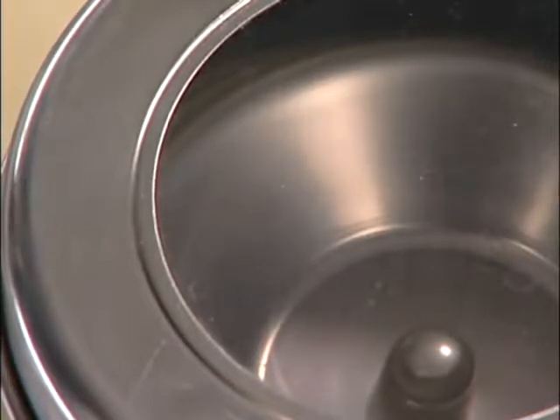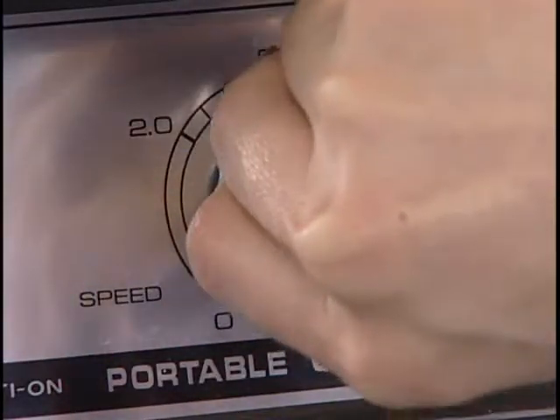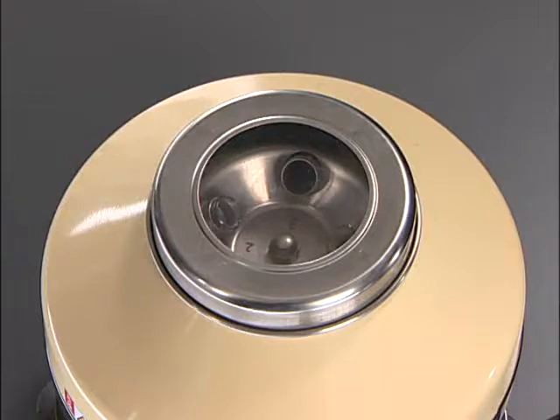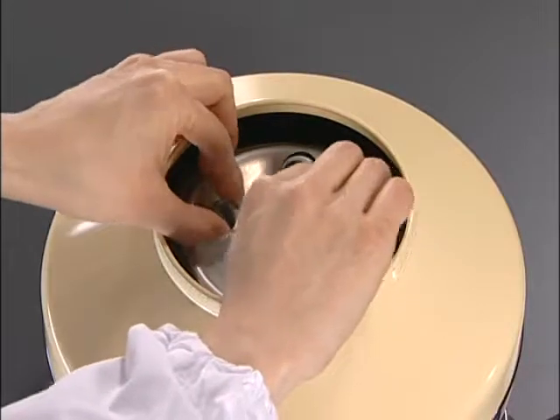It is strictly forbidden to open the cover or put your hand into the machine. Turn off the machine and wait for the rotor to stop completely. Then take out the tubes carefully not to disturb the precipitate.